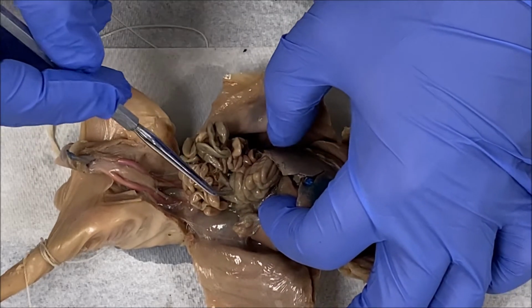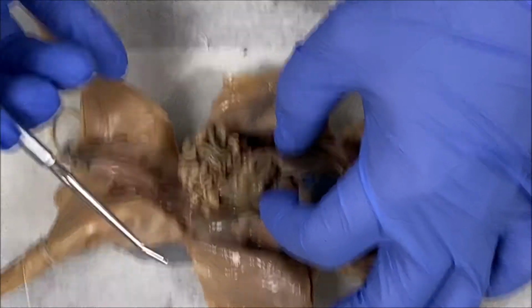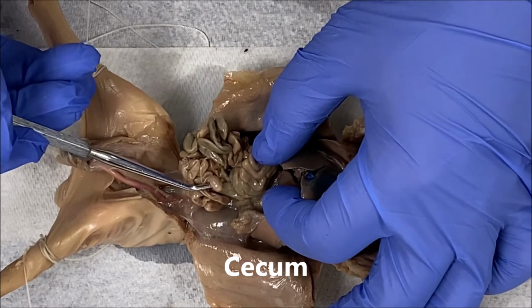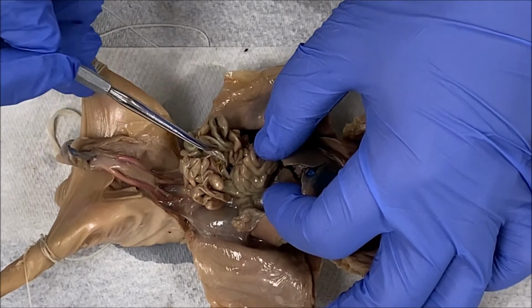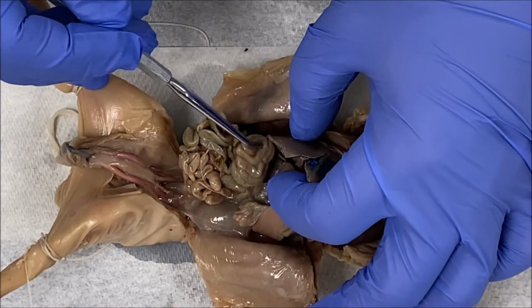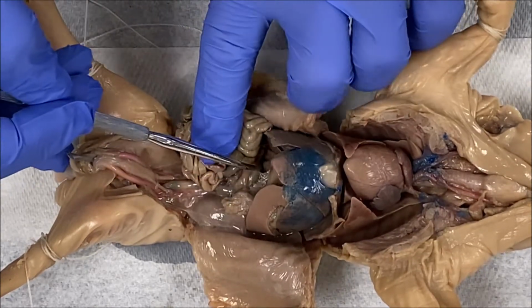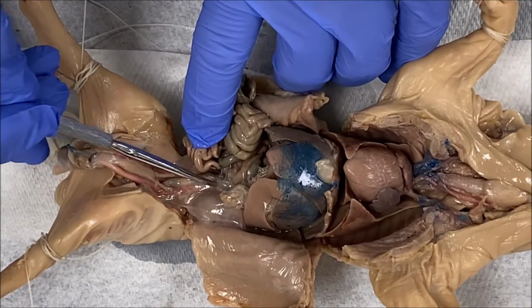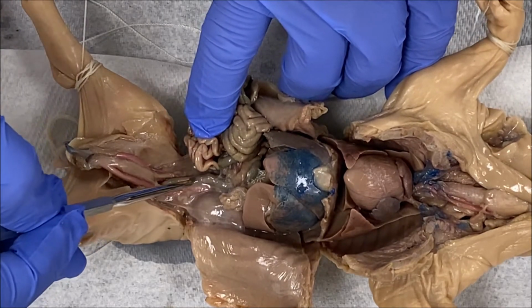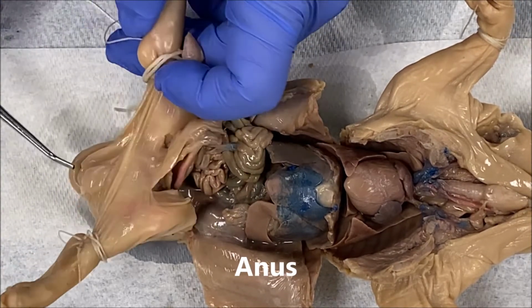So from the ileum, then you have the large intestine, right? And the different parts of the large intestine will be hard to distinguish in a fetal pig, so I'm really not going to go over the different sections of the large intestine other than the cecum, which is clearly visible right here, okay? So you have the ileum, which is part of the small intestine, then you have the cecum, which is part of the large intestine, and then you have the large intestine itself, right? And then I've showed you before the large intestine, as it finally coils posteriorly, and then you have this long, right? This would be the descending colon. That's probably the only thing that I can actually show you of the colon, followed by the rectum, and then the external opening would be the anus down in here.